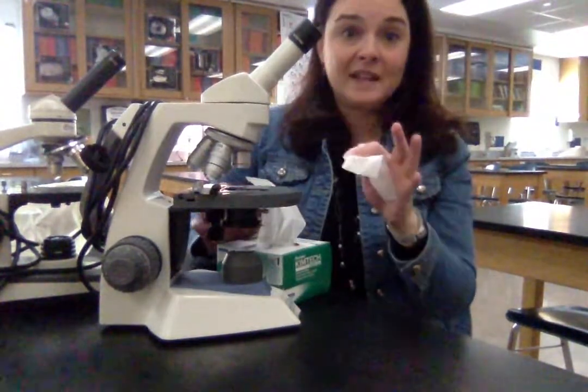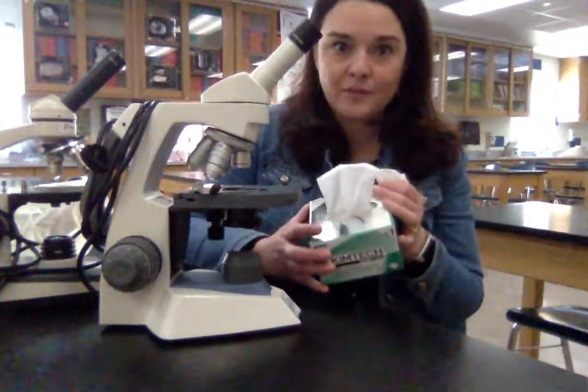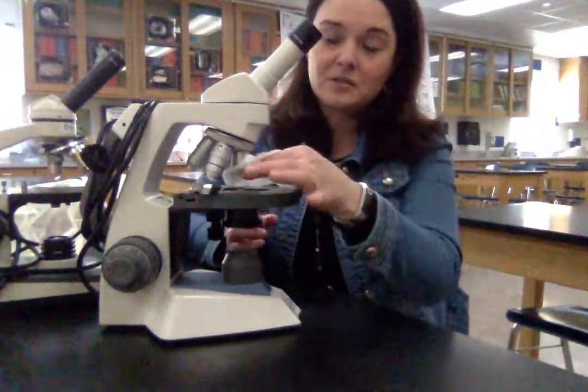This is the eyepiece, and it contains a lens that magnifies 10 times — the eyepiece alone can magnify 10 times. We want to make sure we're never touching the eyepiece, not just for COVID reasons, but because our fingerprints have oil on them. If you think your eyepiece has a fingerprint or is smudgy, let your teacher know and we can use these special wipes to gently wipe off the lens — they don't leave lint and they don't scratch. This is not a tissue box; it's for wiping lenses, and can also be used on the objectives.